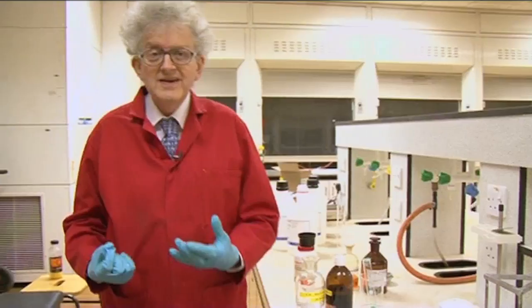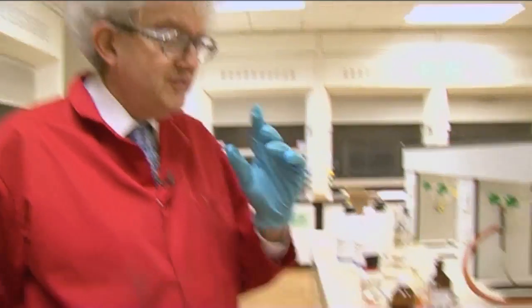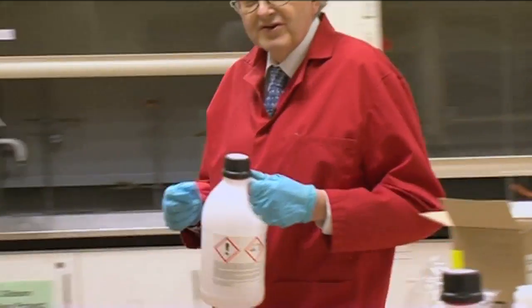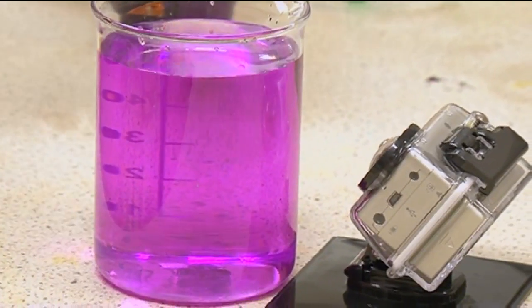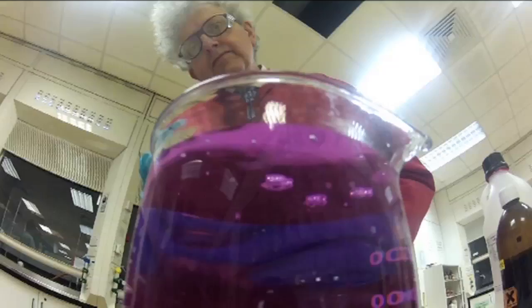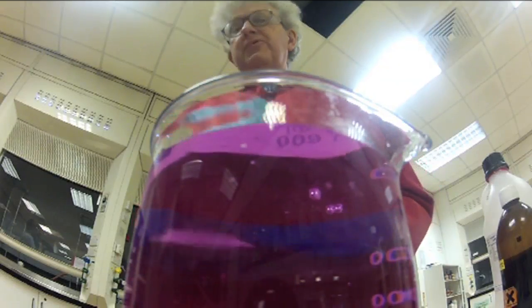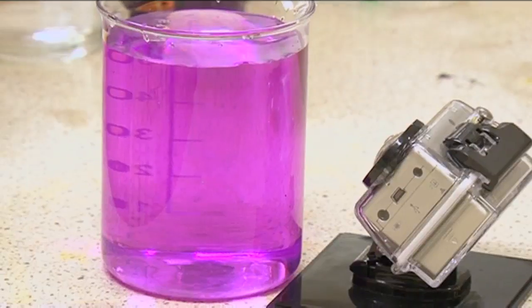Well, hydrogen peroxide can decompose into oxygen and water, and if you keep it too long, it goes off. So I'll get some more. There isn't very much of it, but perhaps this will be enough. I'm not very impressed. Are you? It's not the best thing I've seen.